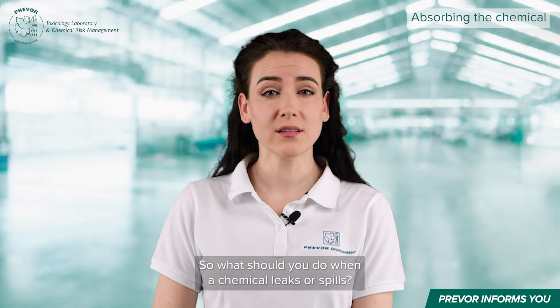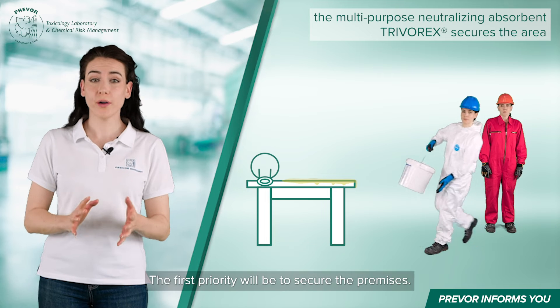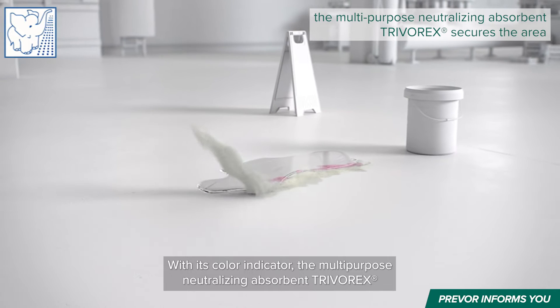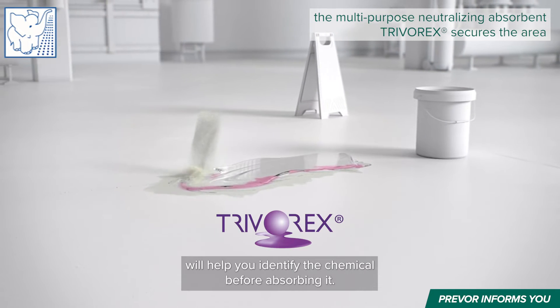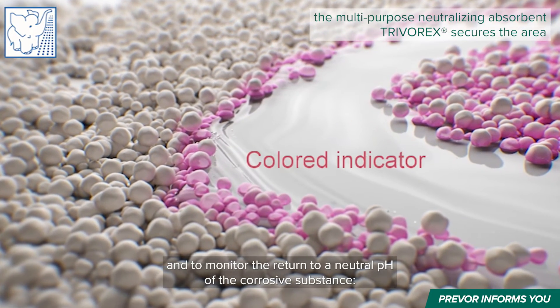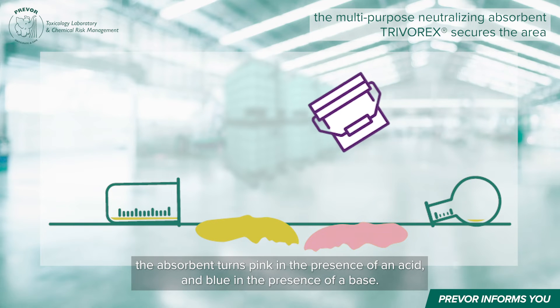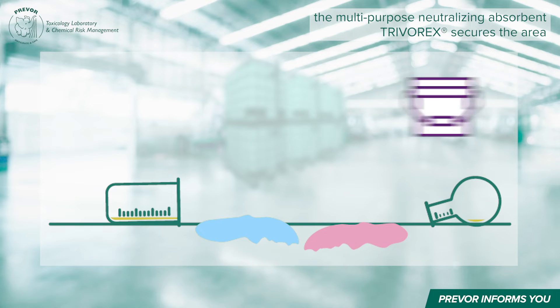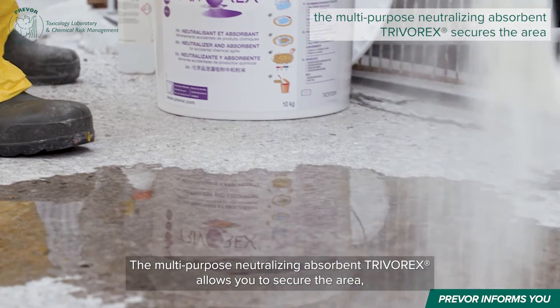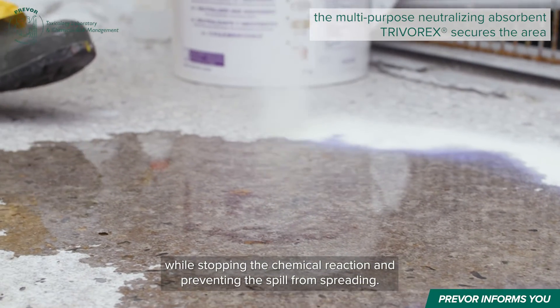So what should you do when a chemical leaks or spills? The first priority will be to secure the premises. With its color indicator, the multipurpose neutralizing absorbent Trivorex will help you identify the chemical before absorbing it. It allows you to identify the associated danger and to monitor the return to a neutral pH of the corrosive substance. The absorbent turns pink in the presence of an acid, and blue in the presence of a base. It regains its initial color when it returns to a non-hazardous pH. The multipurpose neutralizing absorbent Trivorex allows you to secure the area, while stopping the chemical reaction and preventing the spill from spreading.